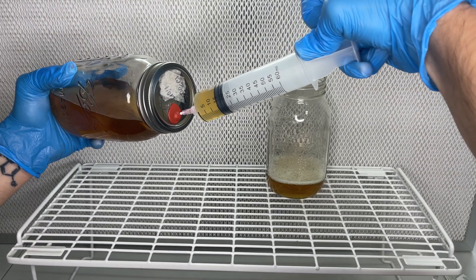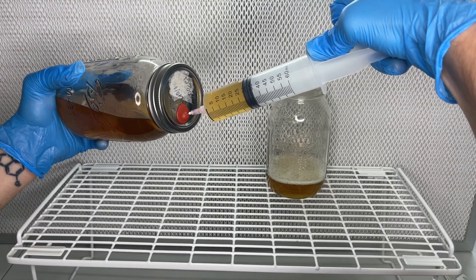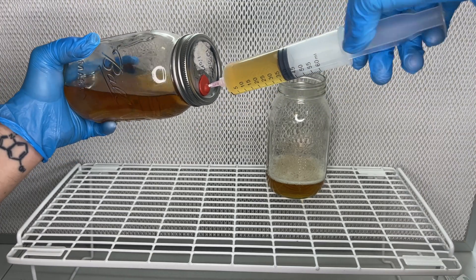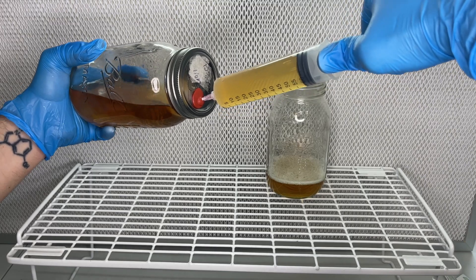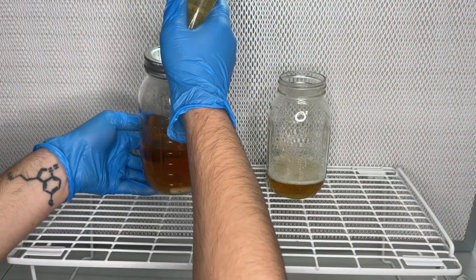Doing this has saved me a lot of time because with all that extra liquid, I'd usually be twirling the jar waiting for the clouds of mycelium to pass by the needle, and hopefully sucking up most of the mycelium without a lot of liquid.